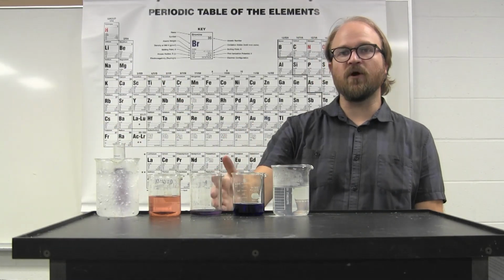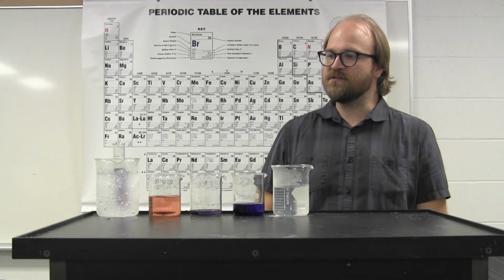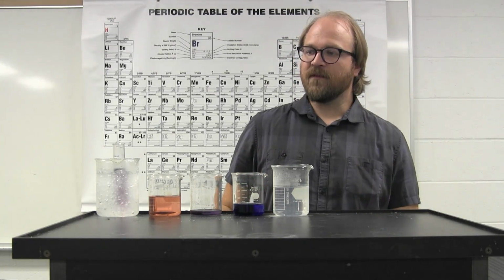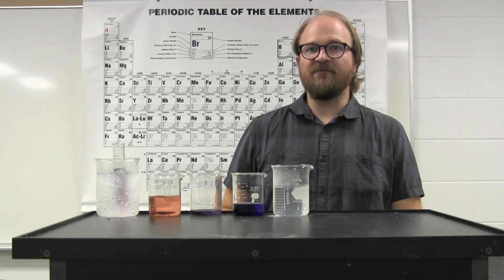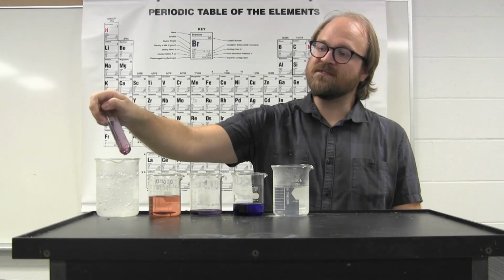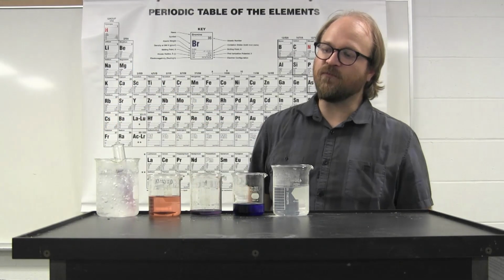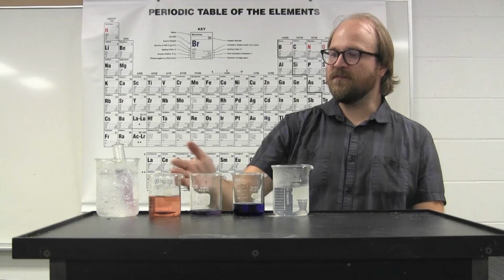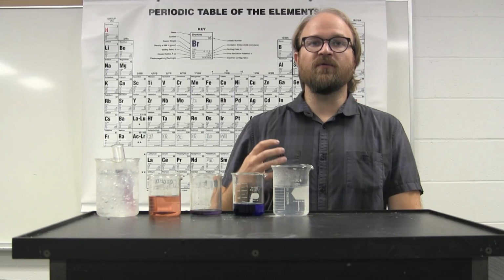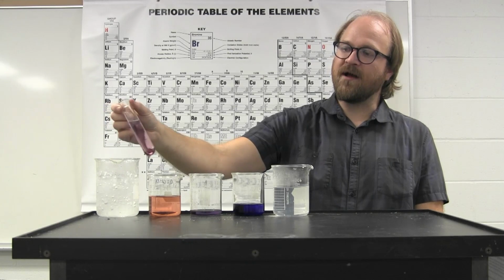By placing the purple blend in an ice mixture for a few minutes or so, the equilibrium shifts to one side. This can be seen because after a few minutes, you can see that it's noticeably much more red than it was initially, especially towards the bottom of this test tube. As it's cooling down, the equilibrium shifts and favors the red hexaquo complex.